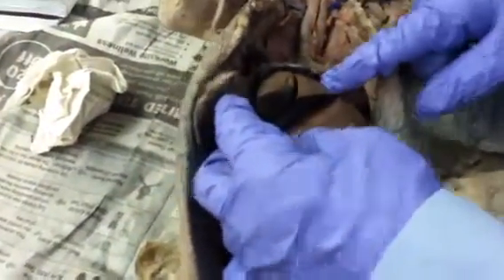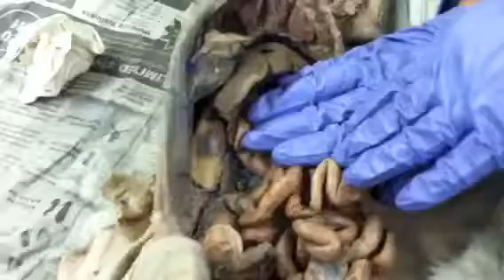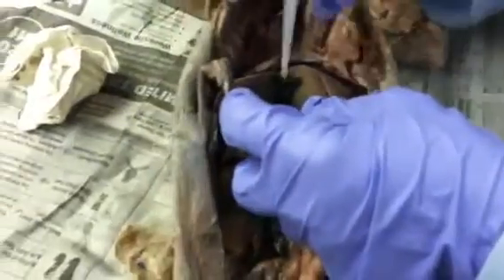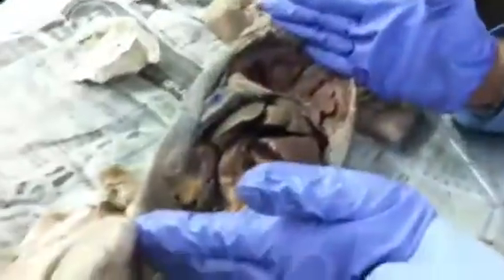The right medial lobe has the gallbladder, and the left medial lobe. And they have right lateral and left lateral and caudate. But these are the 2 you need to know for the test: right medial with the gallbladder and left medial, because this is like ours. And where's the gallbladder? The green thing, that's the gallbladder, and that's where bile is stored. This is the diaphragm, and that separates the thoracic cavity from the abdominal cavity.